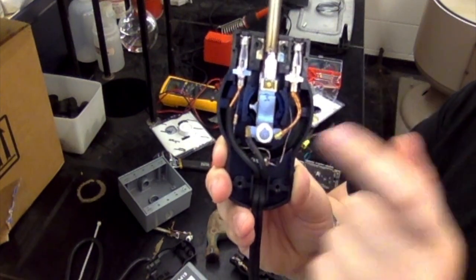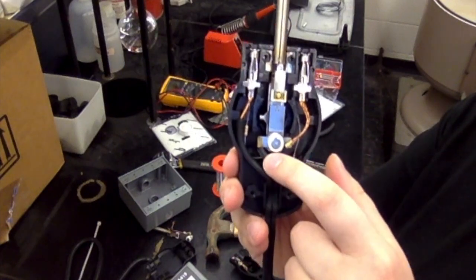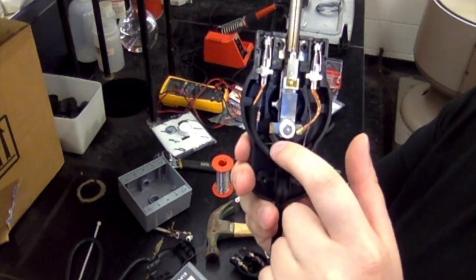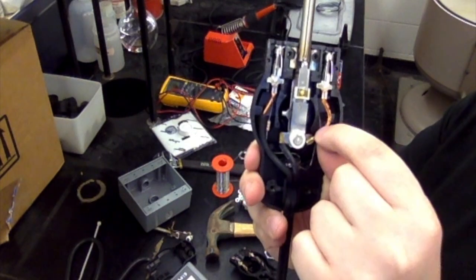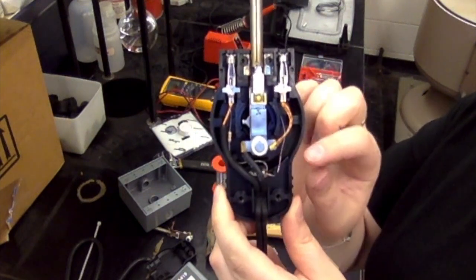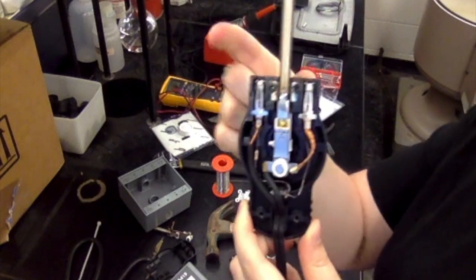A good thing to keep in mind is you have to have overlap to solder, right? So when you go to cut these lines, don't cut them towards the bottom or towards the end. You're going to want to cut them pretty close so that when we go to connect them, you have overlap. Once you cut these 2 lines, this piece here, the thermocouple, is going to come out pretty easily.